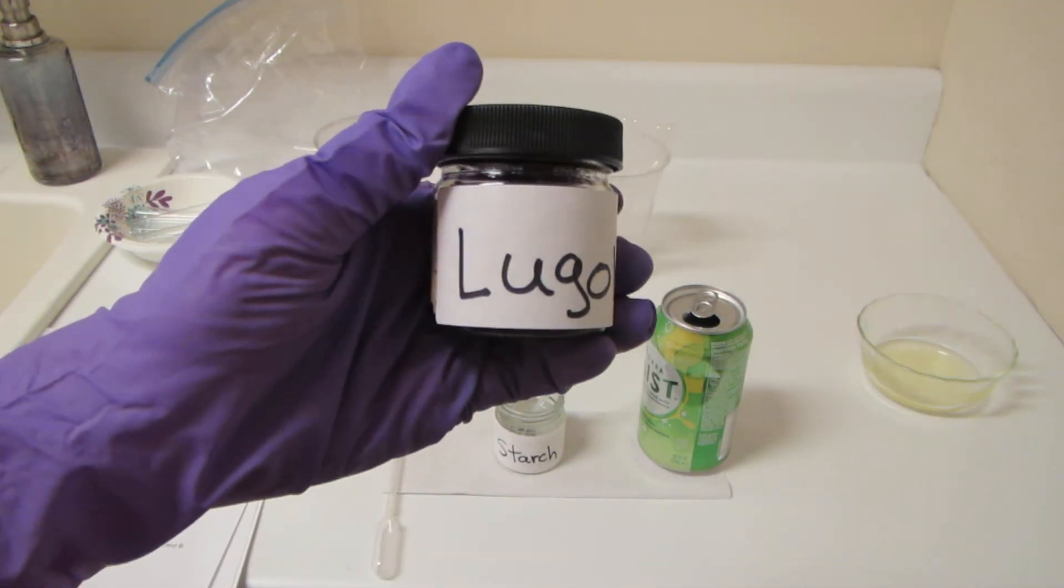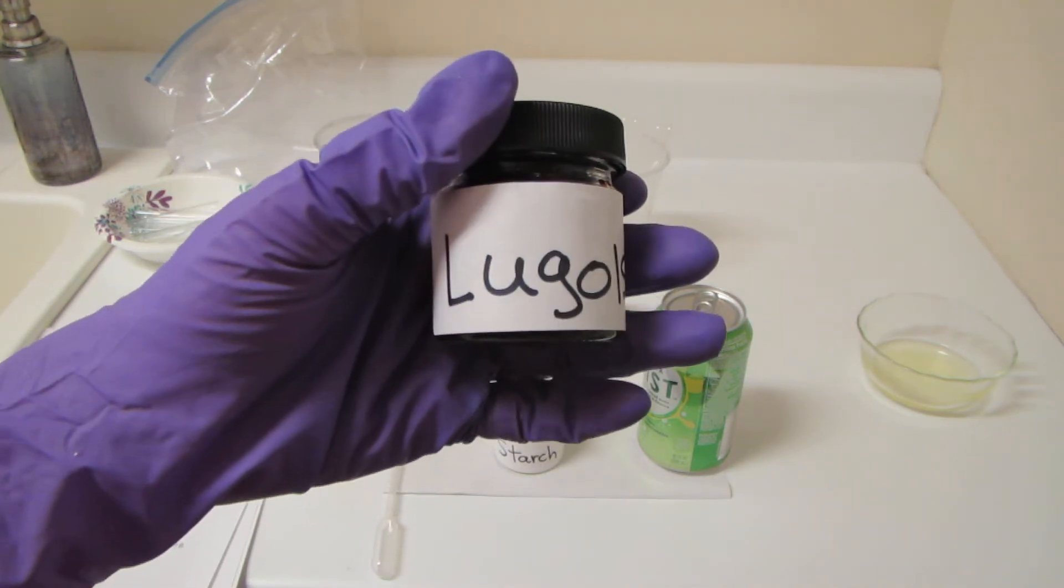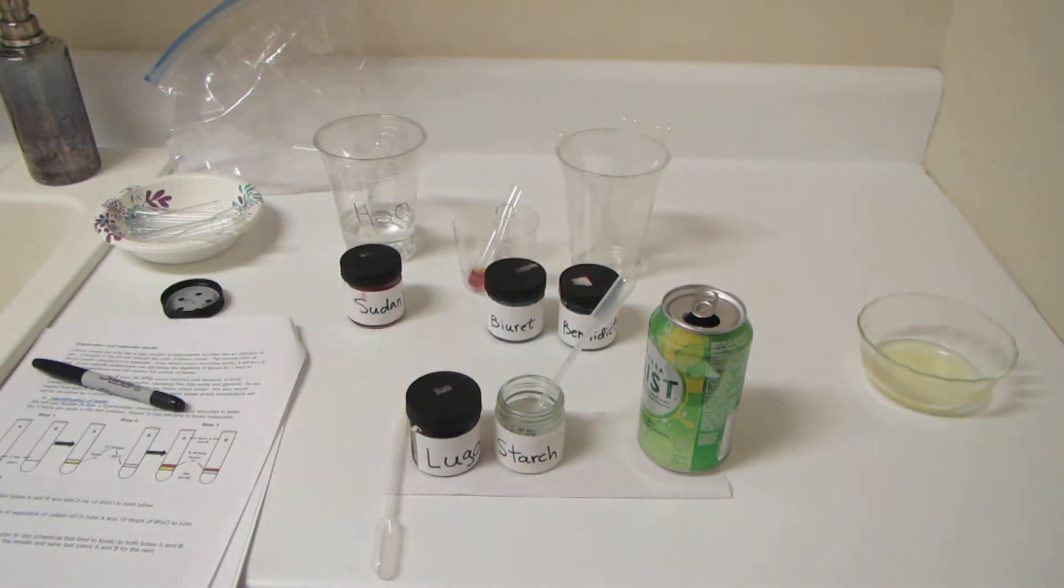As a reminder, Lugol solution is an iodine-based solution, and this is what we use to determine if starch is present.